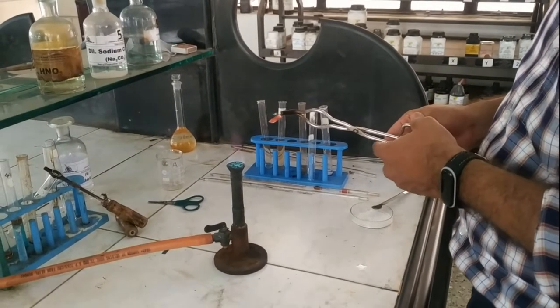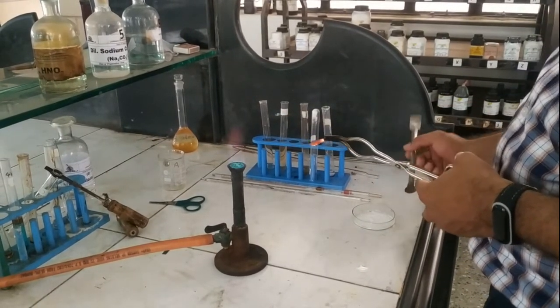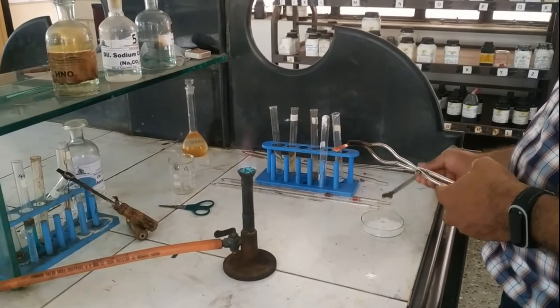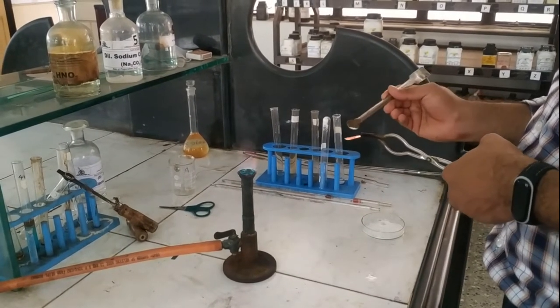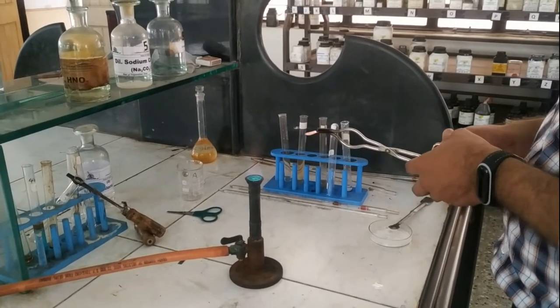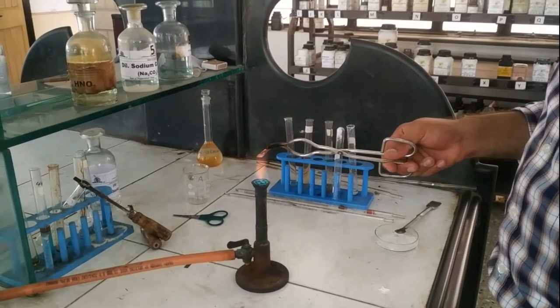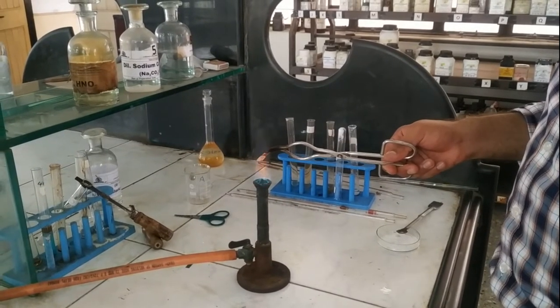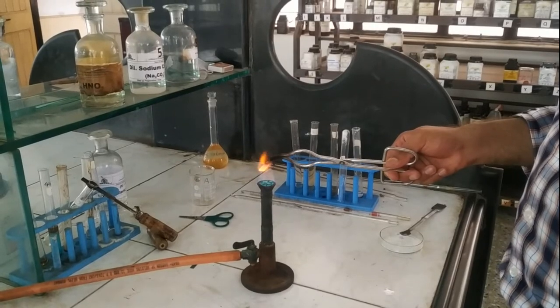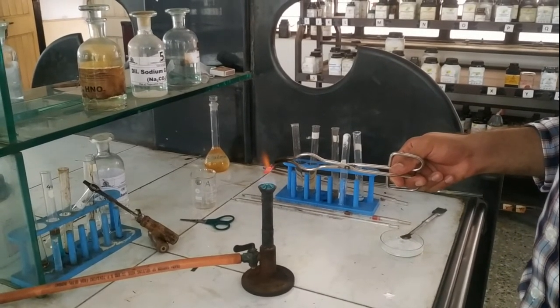Now we can perform the flame test practically. The procedure is to add a pinch of the compound on a copper foil and heat on a burner. Here the flame is non-sooty, so our compound is an aliphatic compound.